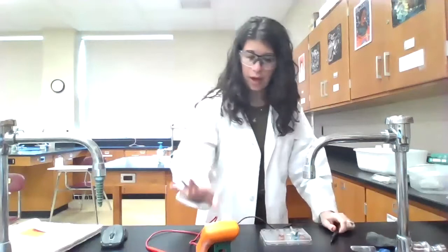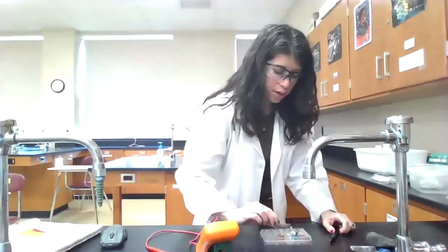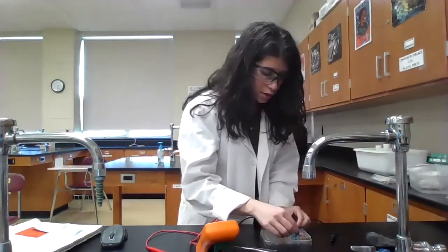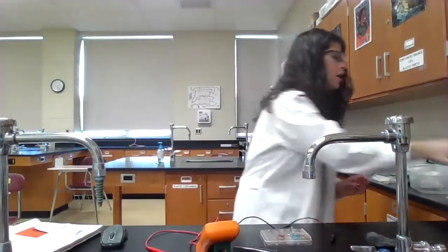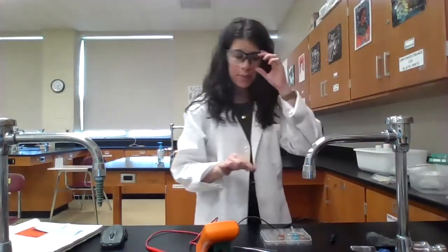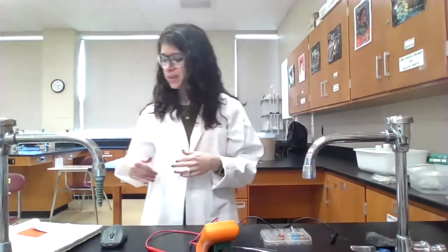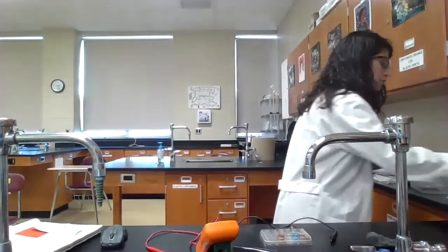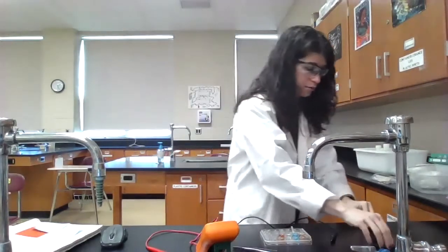So now, I would record that number. I'm gonna just dispose of my salt bridge. And I'm going to take out my piece of copper metal. I'm going to leave my zinc metal in here though, because again, I'm testing everything relative to the zinc. So that was my zinc copper. Now let's test zinc and silver. So I have my piece of silver metal here.